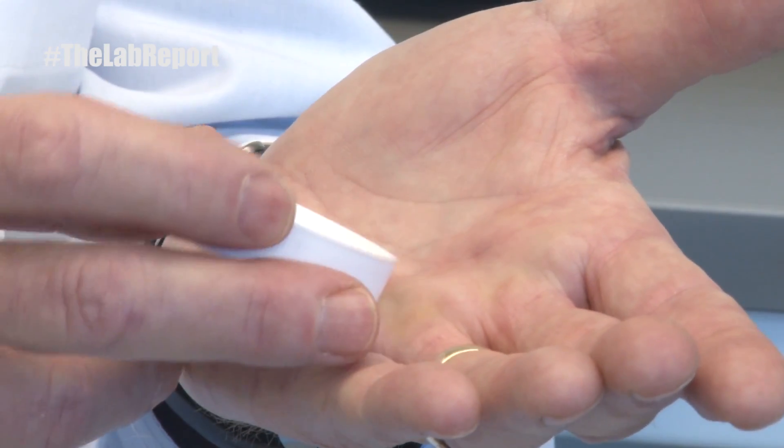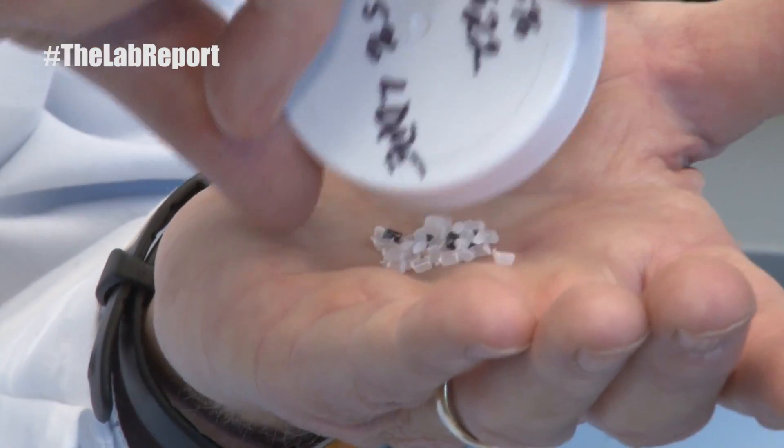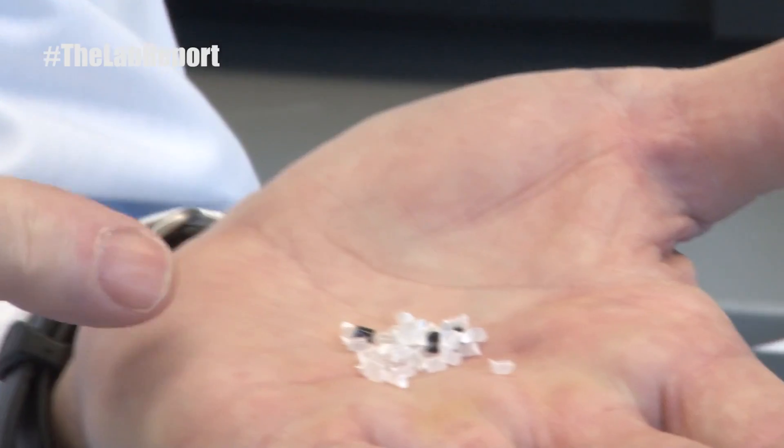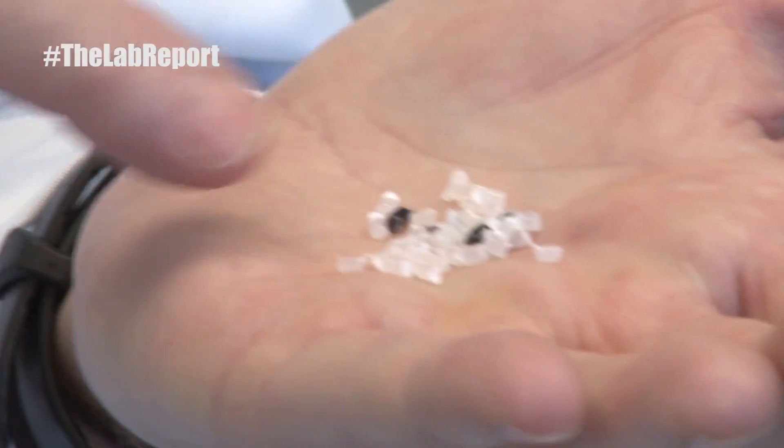A good example would be in a manufacturing environment when someone submits a contaminant from the process line. Here's an example of that: if you're a polymer analysis company producing polymer pellets, and suddenly your polymer pellets are obviously different in composition — you can see differences that may be in color or in size for the sample.